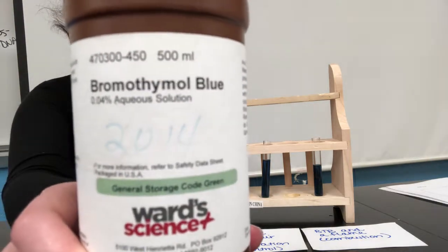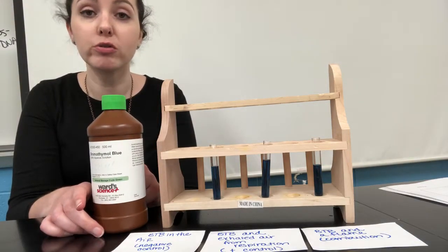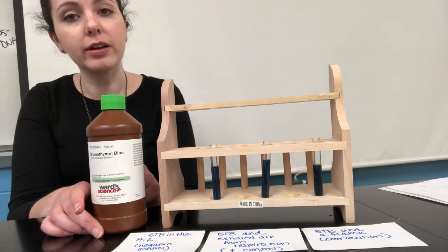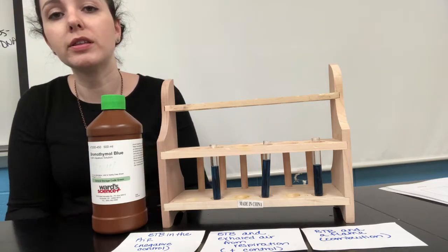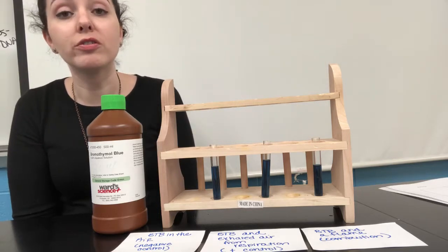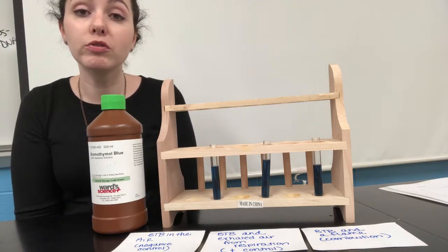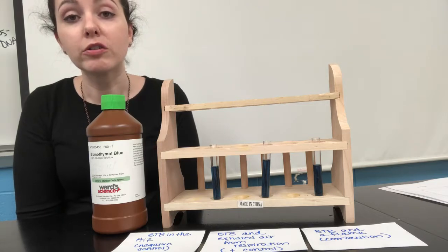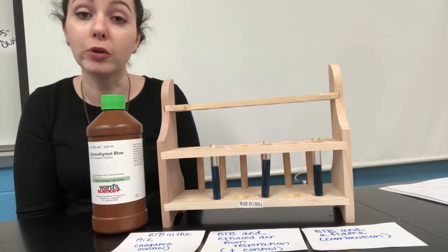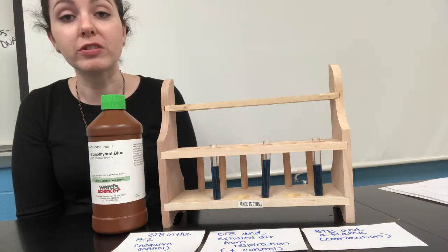So you can see that right here. It's a blue color, and it can actually change to greenish or yellowish in color. So when there's not a lot of carbon dioxide mixing in, the BTB will look blue. As more carbon dioxide gets dissolved in it, it turns more and more green and then more and more yellow. So basically a negative result, if we were testing something with BTB to look for carbon dioxide presence, is if there's not a lot of carbon dioxide, the color of the liquid will remain blue. And if there is a lot of carbon dioxide, it will be green or especially yellow.